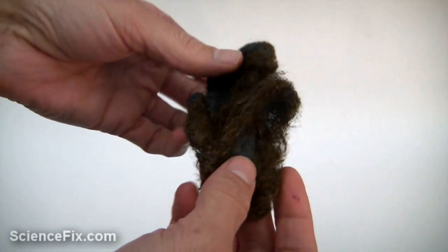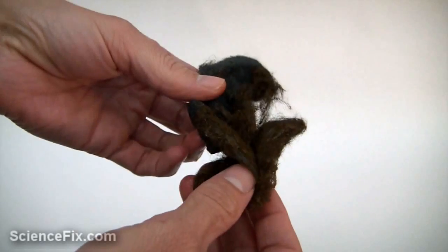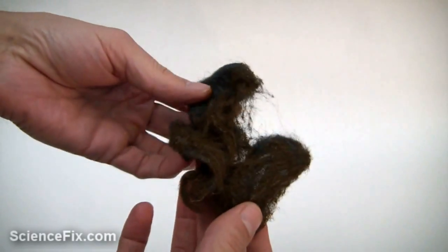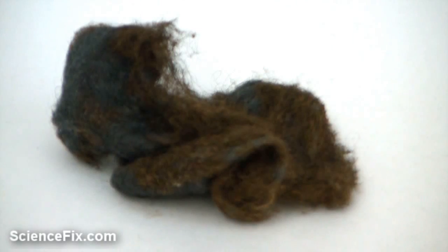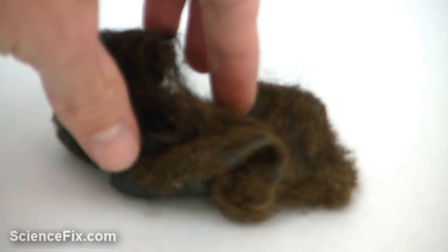Now it has a brownish, reddish color to it. It's also very brittle. The brownish material comes off very easily. That product that was produced in the chemical reaction is iron oxide.